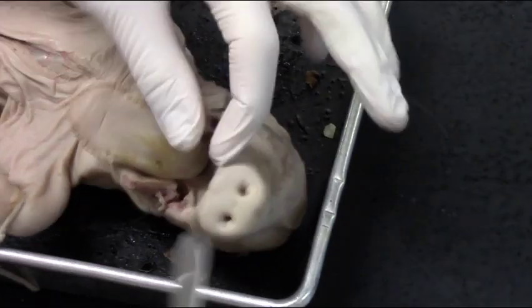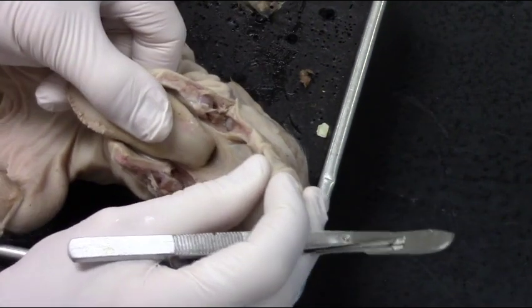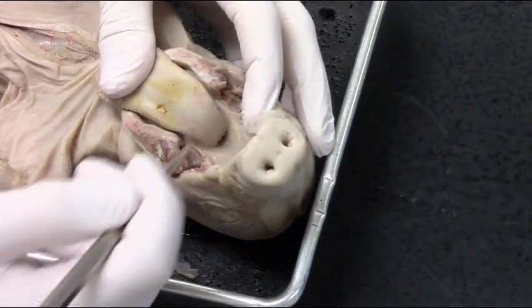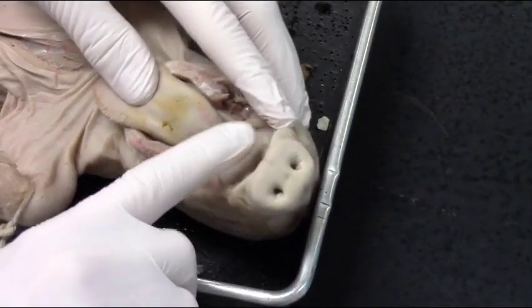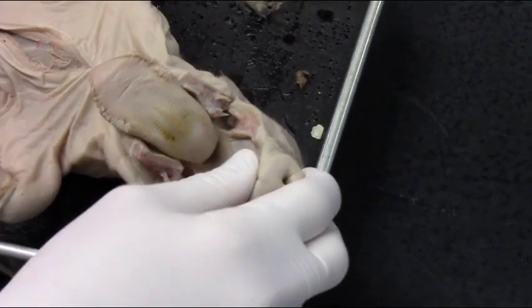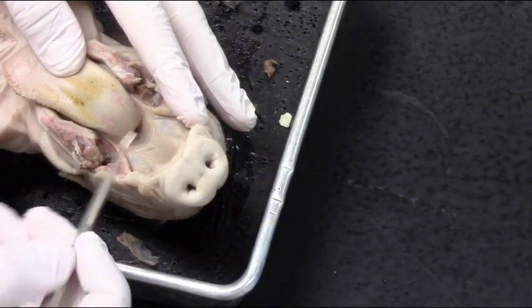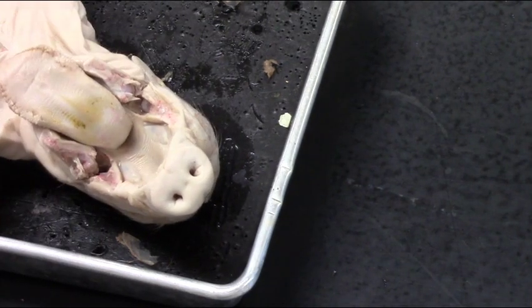That's the top of my hand, but I'm making some really slight incisions in that musculature on either side. I haven't opened up the roof of the mouth and I haven't cut into the tongue. I can start to see the pharynx in the back. I can feel the hard palate right now and I can see the soft palate starting to become a little bit more visible, but I'm not far enough yet.